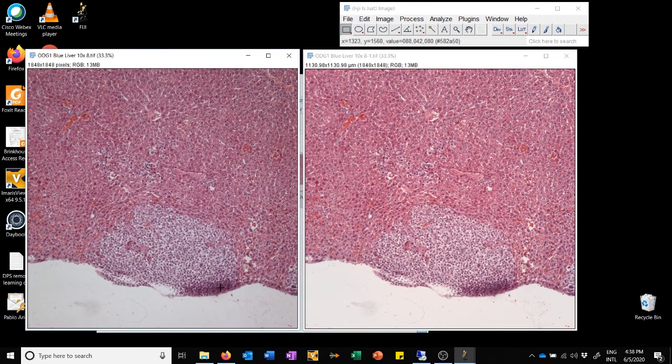You can see that whereas in this image there's a bunch of gunk here, that is gone. So the only imperfections that are left here are ones that were in the sample, not in the light path. Furthermore, you can see that it's a more even image, where the corners, which in the original image were darker, now have a brightness more similar to the middle. And overall, it just looks better, at least to my eyes, and I hope you will agree. So that is what this procedure looks like.